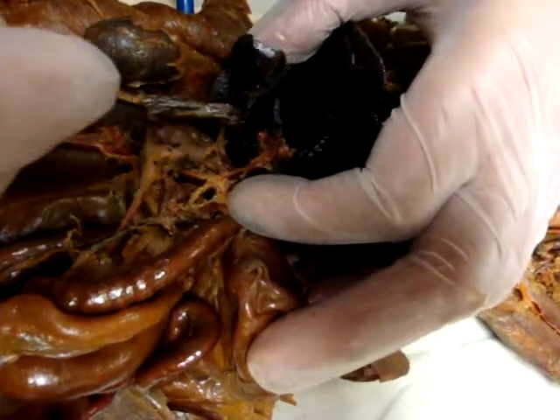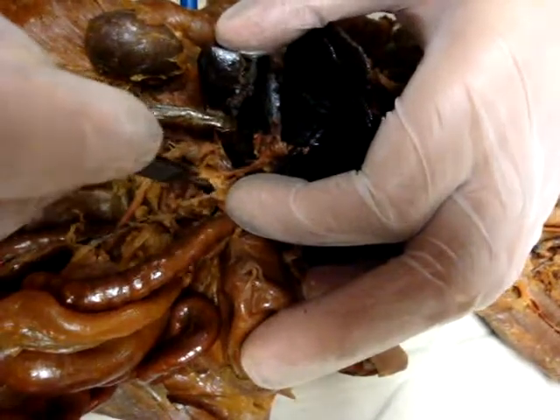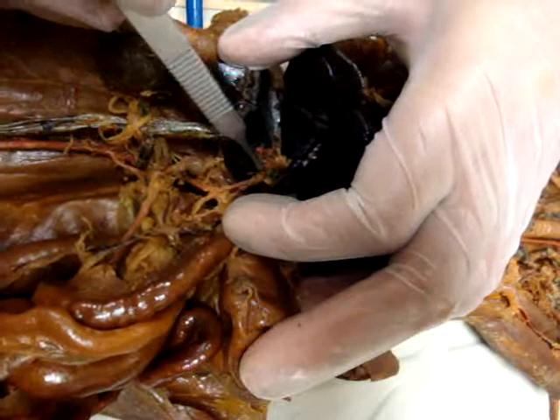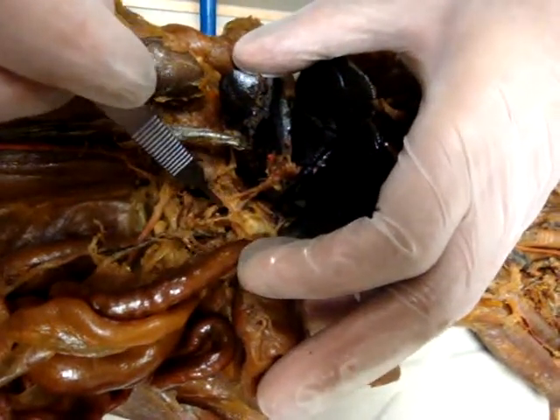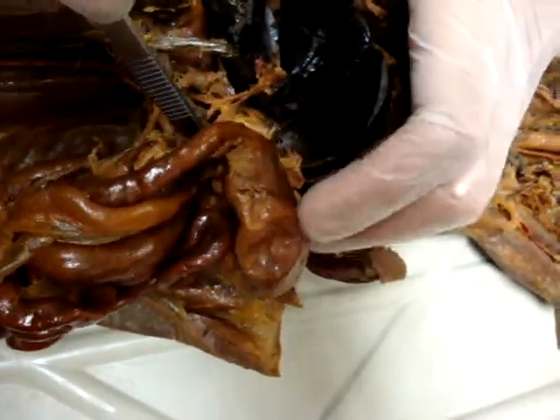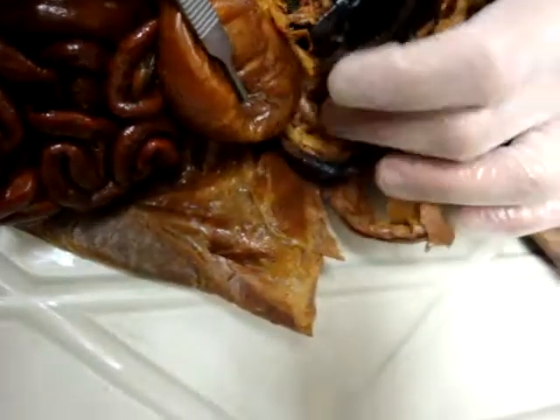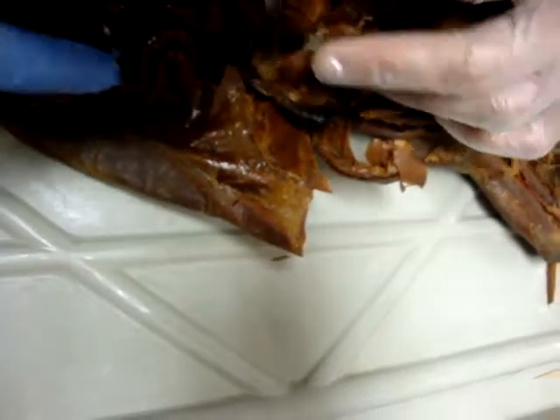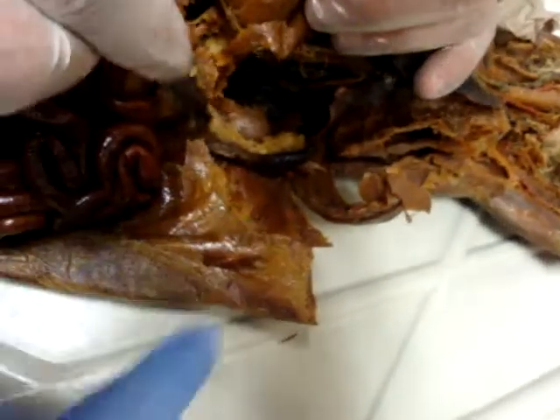Is that the celiac trunk? Yeah, this is the celiac trunk. This is the common hepatic artery. This is the splenic artery. You have to move it the other way, right there. This is the splenic artery.